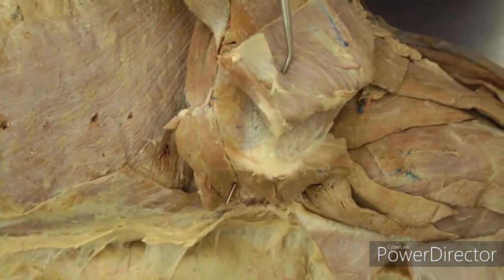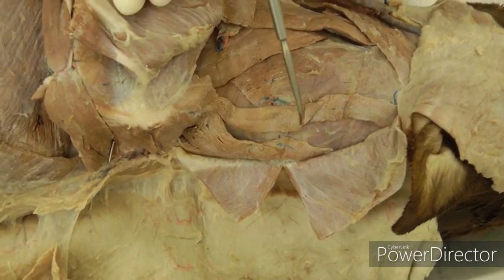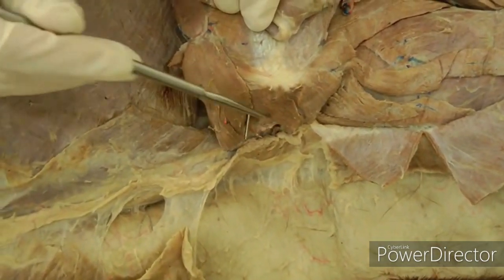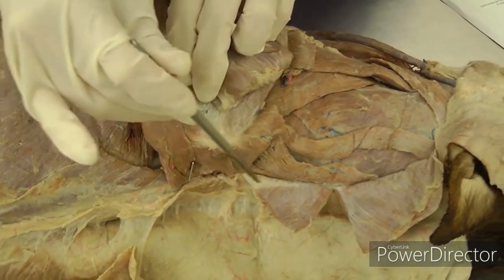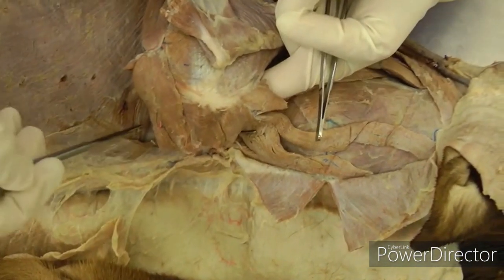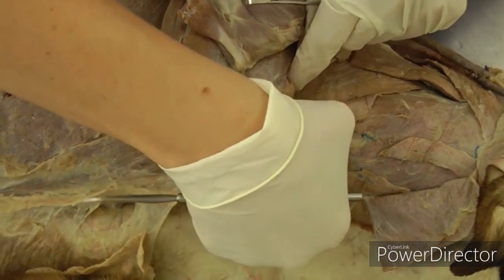Underneath trapezius you will also see rhomboideus, which has three parts. Rhomboideus capitis is a strap going up towards the head. Rhomboideus cervicis goes to the cervical vertebrae, and rhomboideus thoracis goes to the thoracic vertebrae. You're also going to cut rhomboideus — make a cut through all of those different parts. For capitis, I usually try to leave it a little bit longer so you can identify it, leaving a stump on both sides, then reflect the rhomboideus muscle.